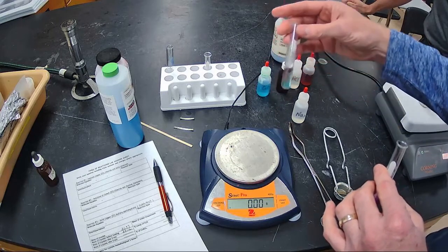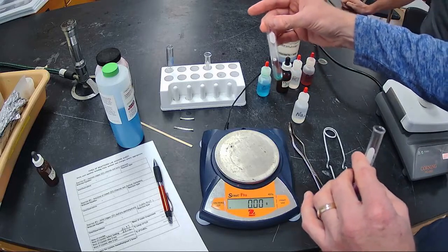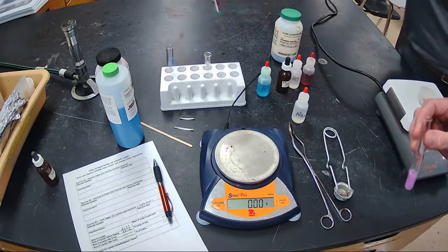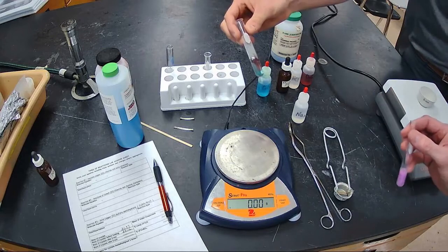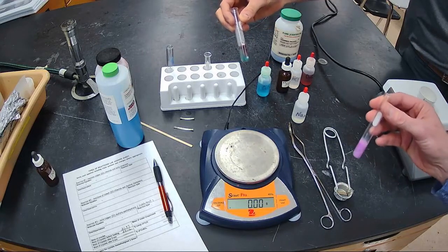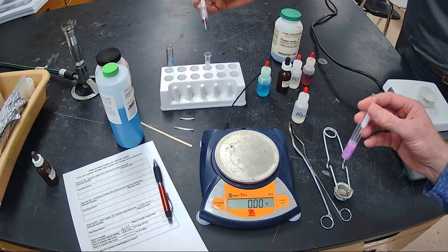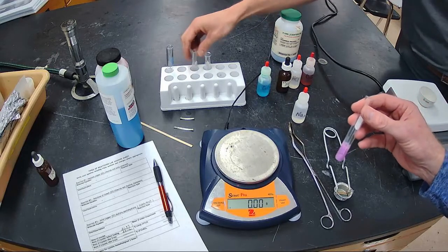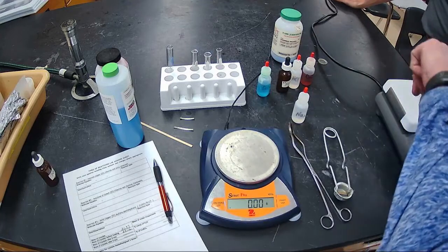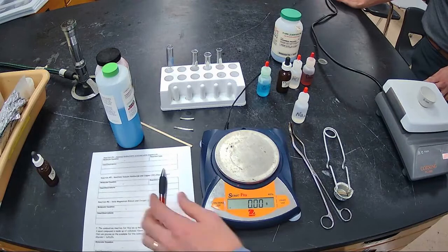You want to know what law I always like to think about with reactions, especially when I'm trying to figure out what's being made? It's the law of conservation of matter. So I know that there's a couple of things that can make this kind of reddish brown color, but if I only have copper, chlorine, and aluminum in it, then that kind of limits what my products could be here. Very good point.